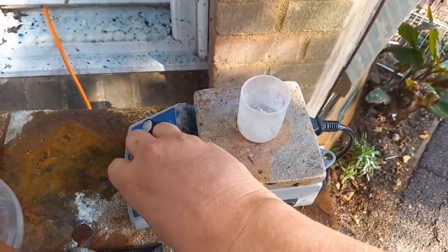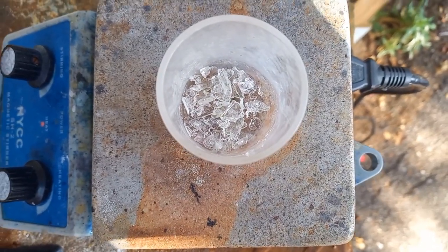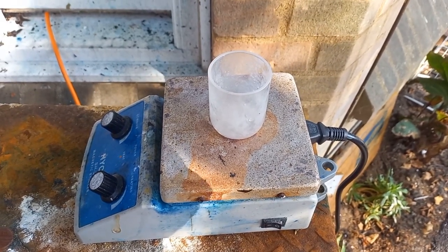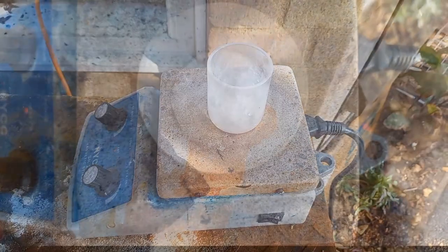I am going to heat these bismuth nitrate crystals. Hopefully this will give off nitrogen dioxide gas and oxygen to leave behind bismuth oxide.